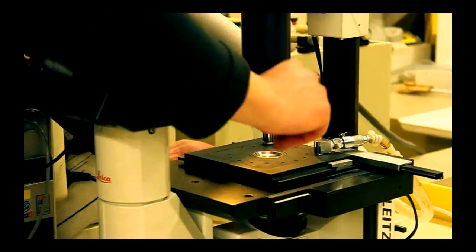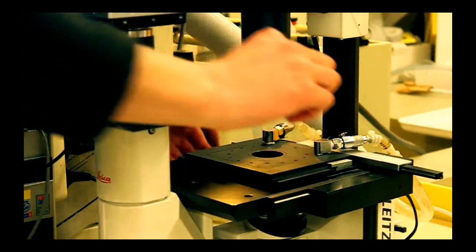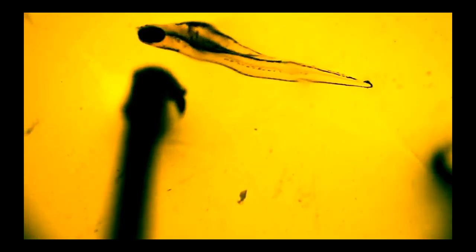After the processing of data, the fish can be gently released from the agarose and returned to the beaker.